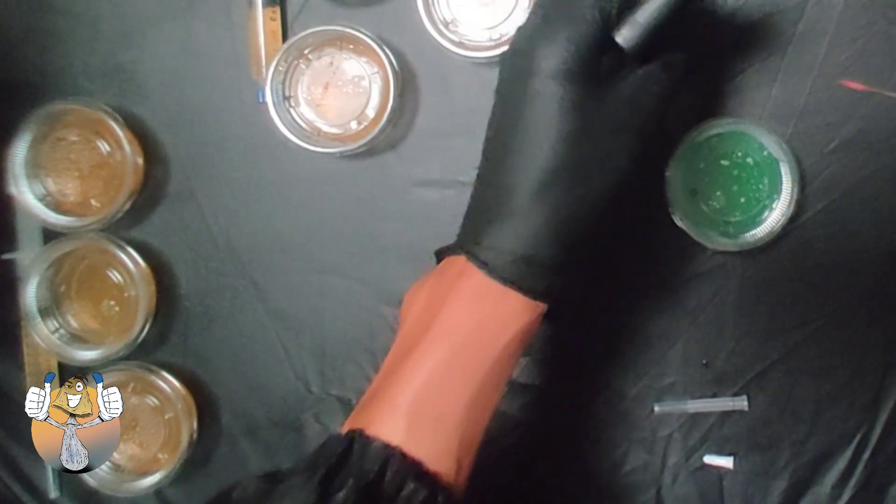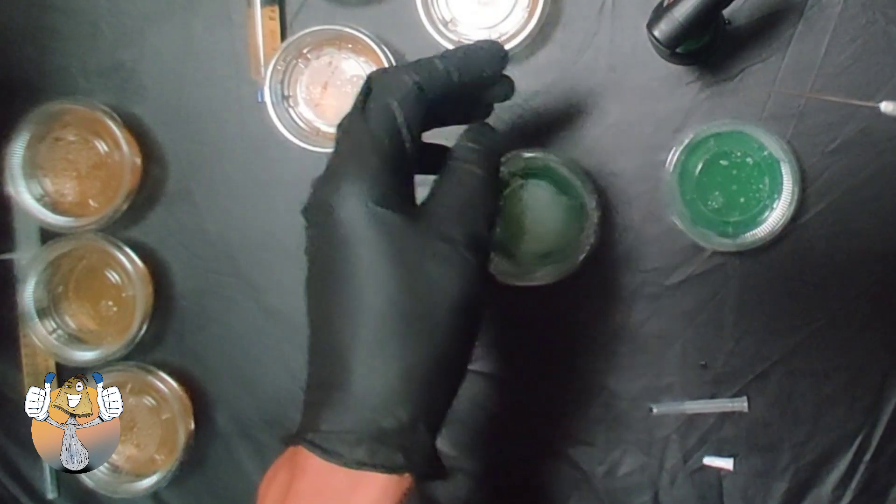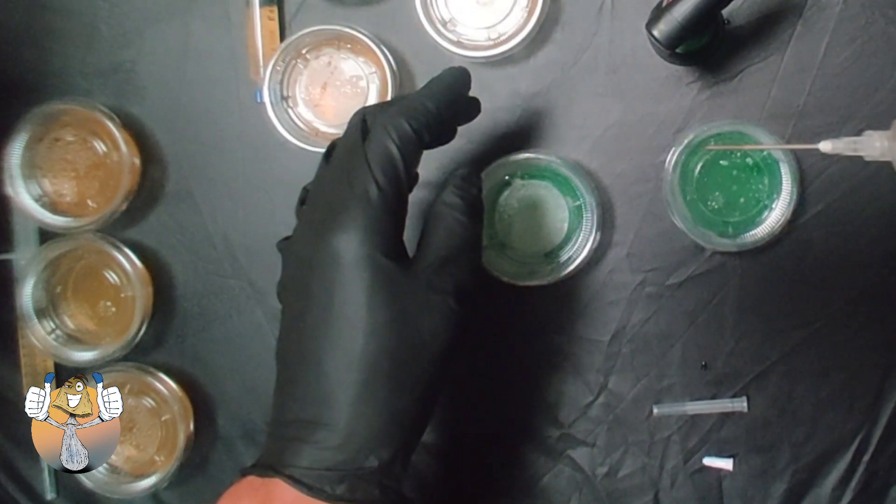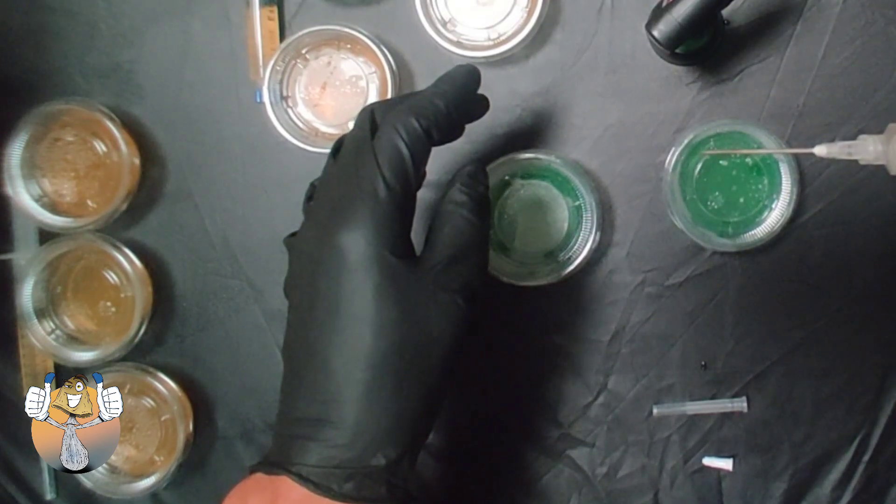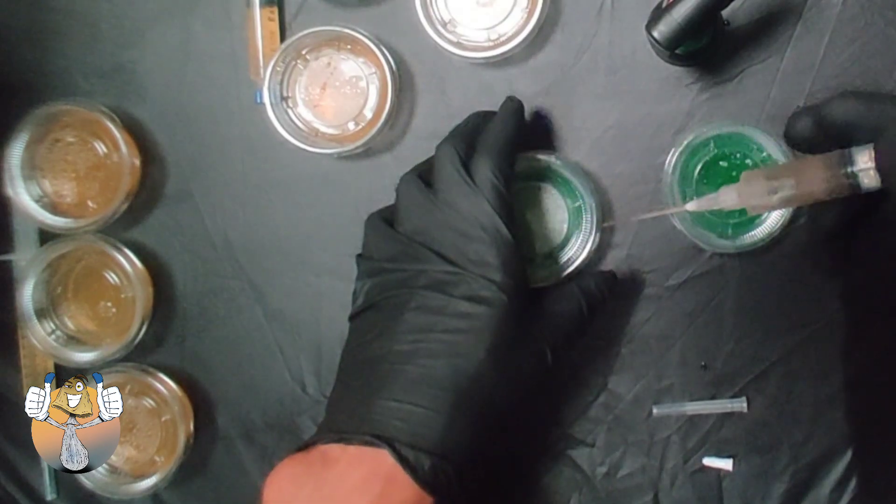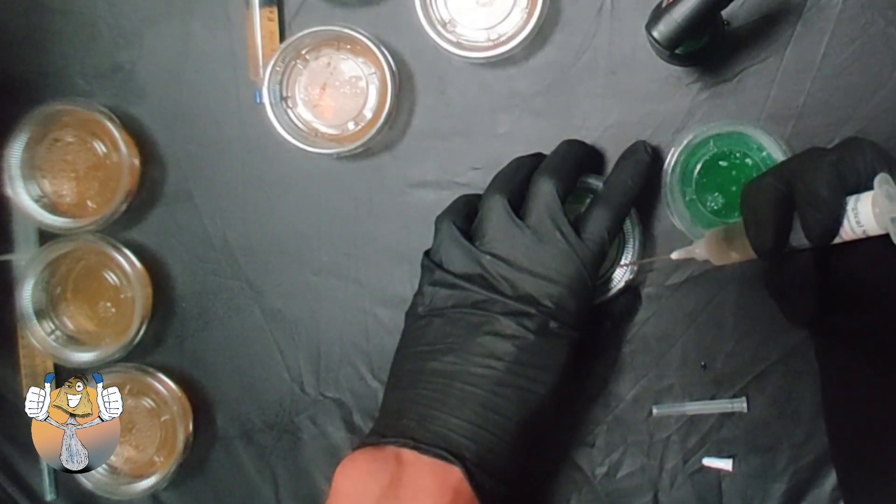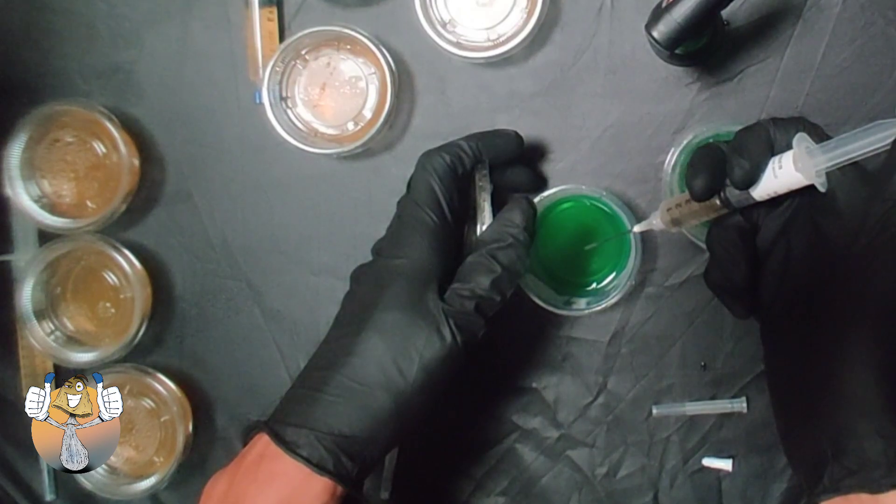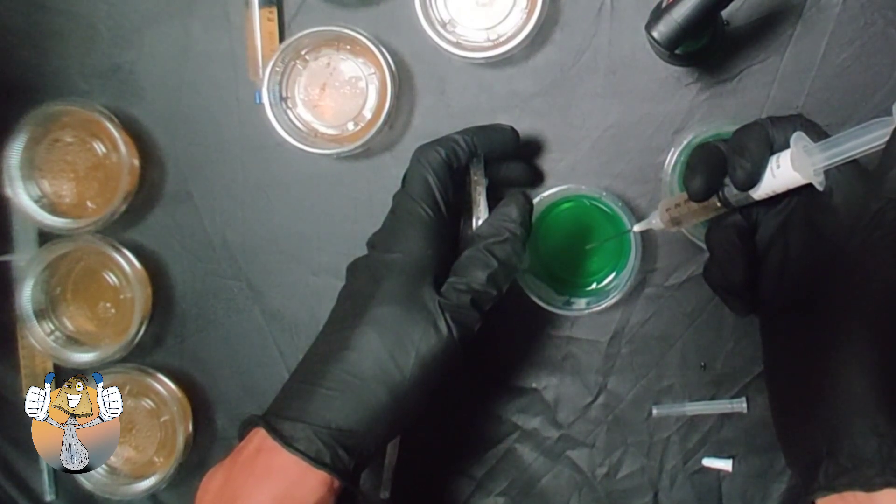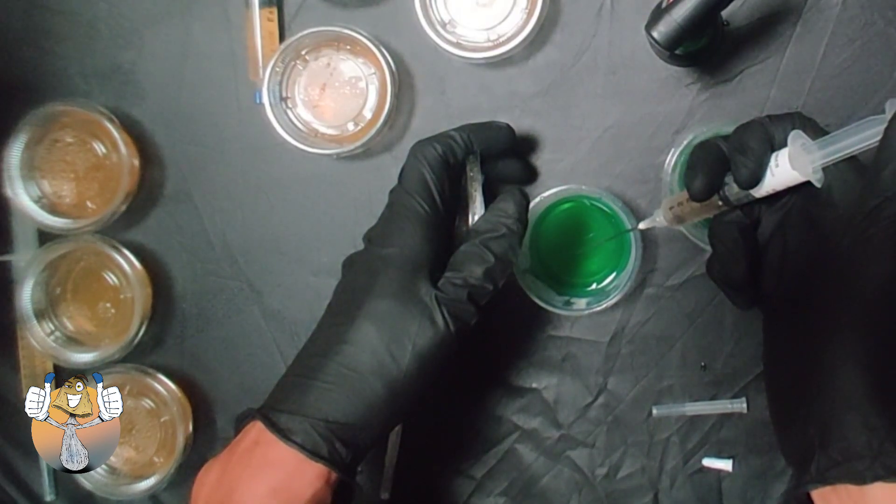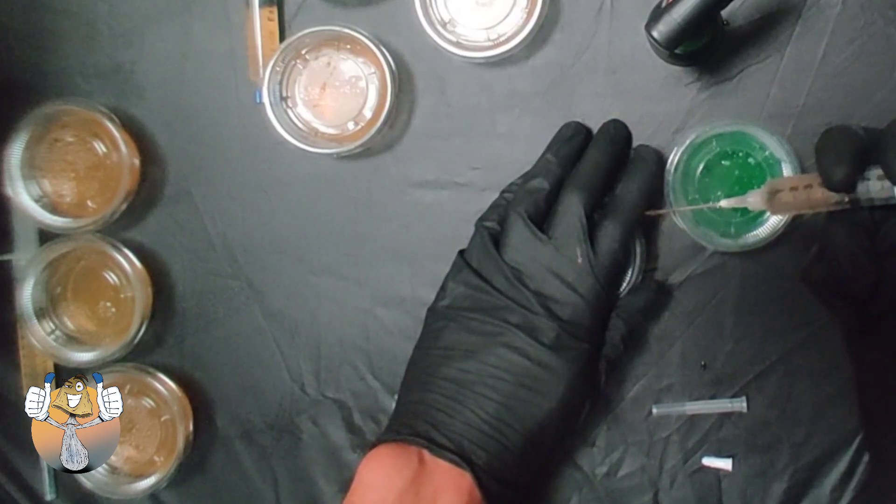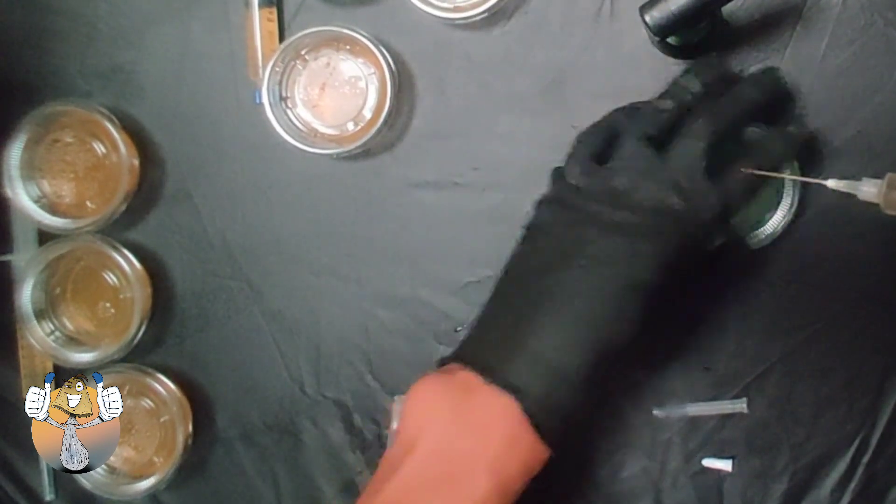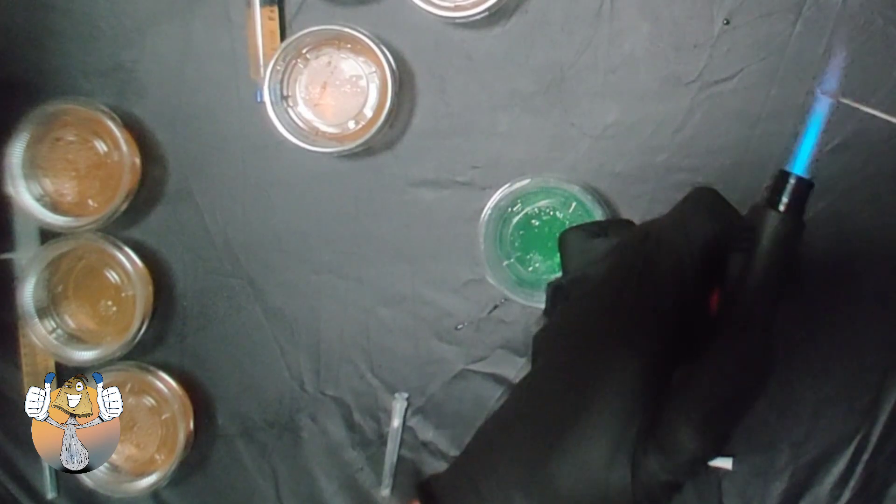All right, all right, we got the last ones. This one is the multi-spore syringe. We're going to go ahead and do the same process, nice and swift, move with intention.